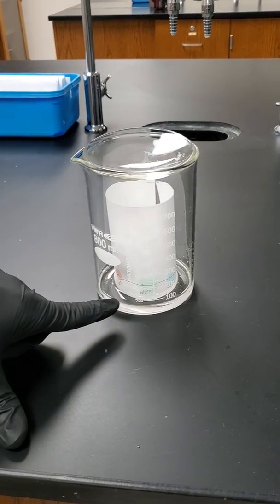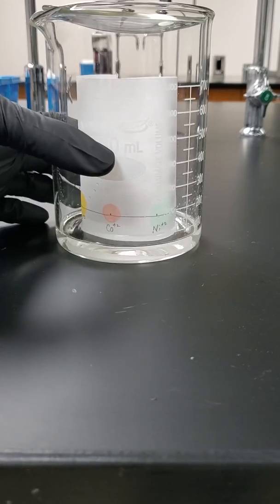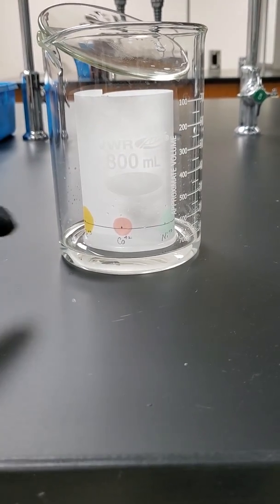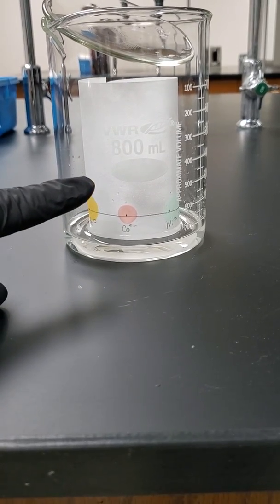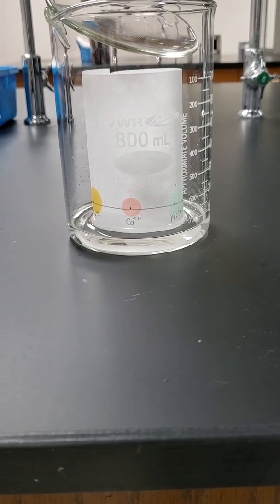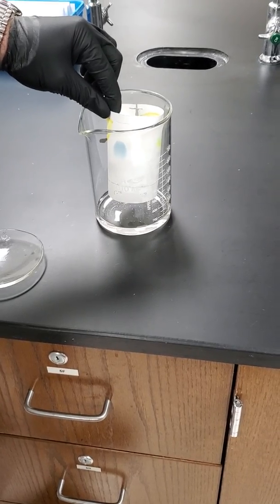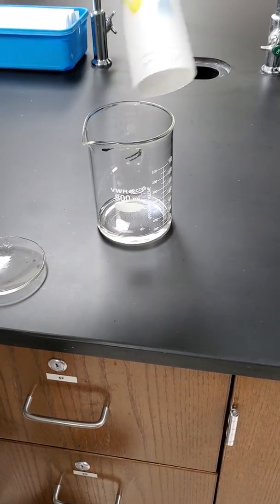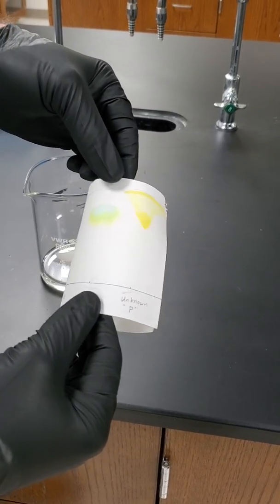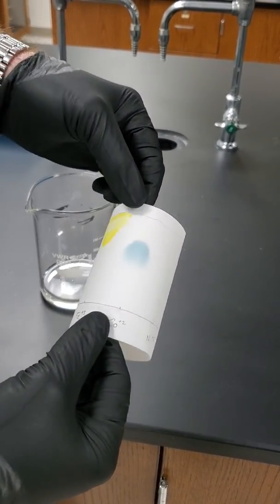So notice you can see already the ions are getting soaked up the paper, and as we get closer and closer, they're going to start pushing off that start line up towards this new finish line in 45 minutes. So see you then. All right, so 45 minutes, poof, went by. And looky there. Our spots have raced up the paper. Some didn't make it, kind of like me in a race. Although some did make it, so maybe when I race my daughter, I try a little harder.